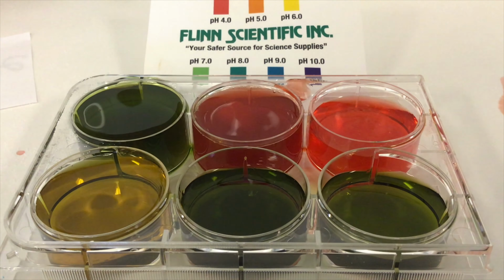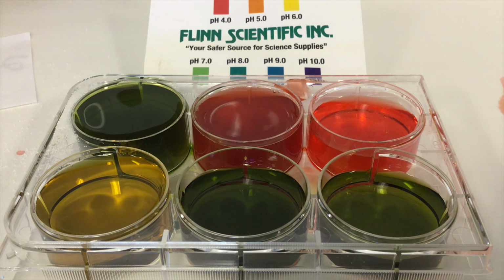In the third well, I have just put sodium bisulfite. Sodium bisulfite's formula is NaHSO3. When there is a hydrogen on an ion, like bisulfite, HSO3 minus 1, you can't tell right away if a hydrogen's going to come off or a hydrogen's going to be added. So you interact it with an indicator, and by putting the salt into the water, I see that I get an acidic substance.